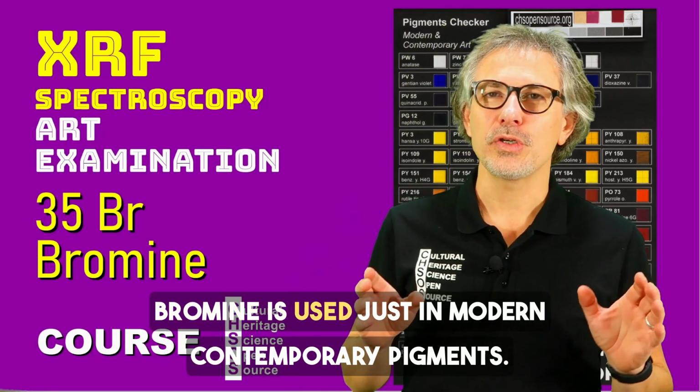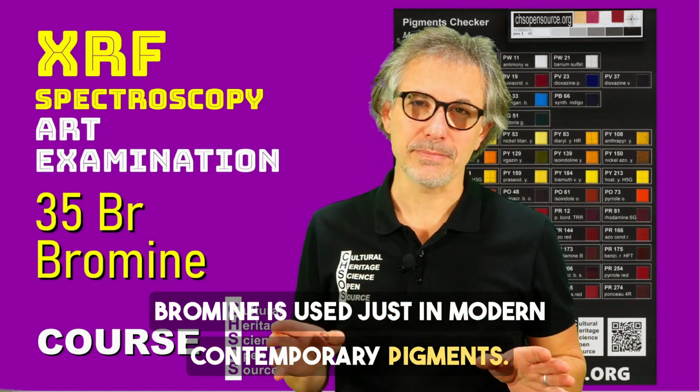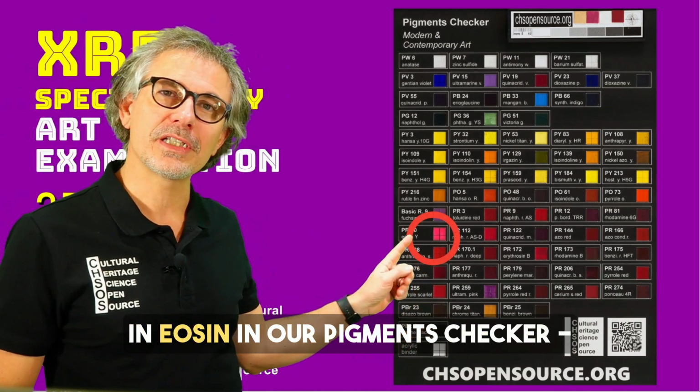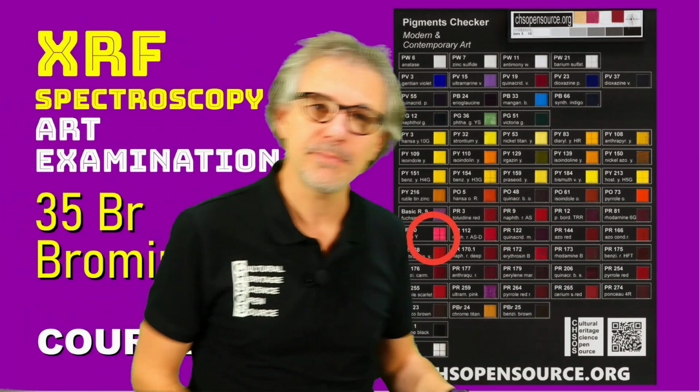Bromine is used just in modern contemporary pigments. We can find bromine over here in eosin in our pigment checker modern and contemporary art.